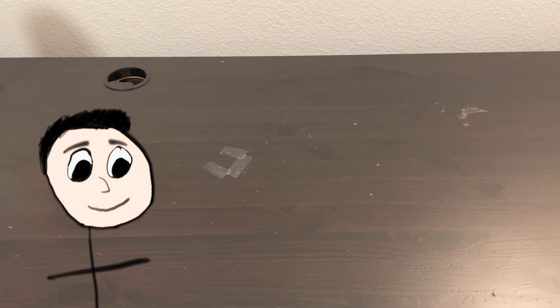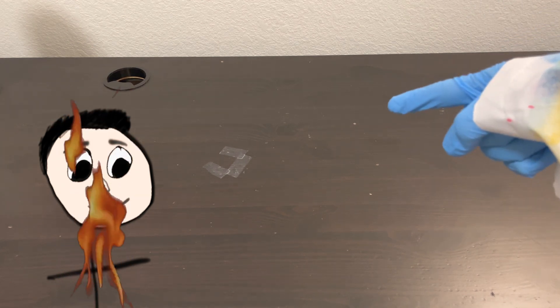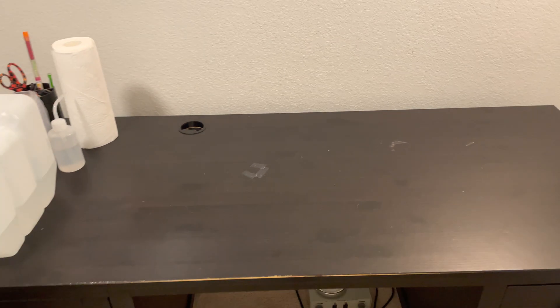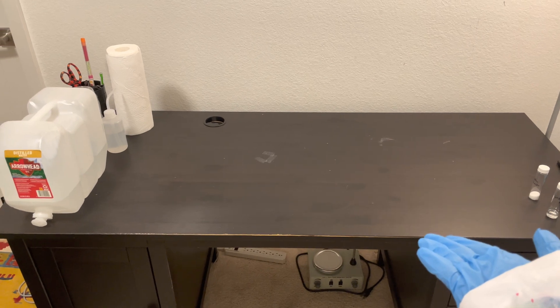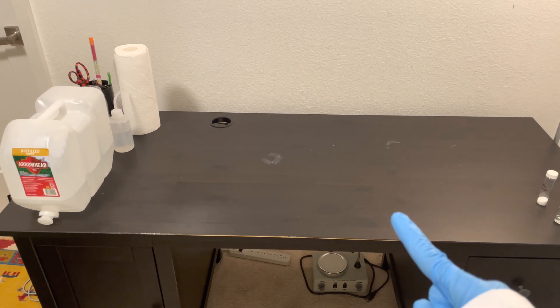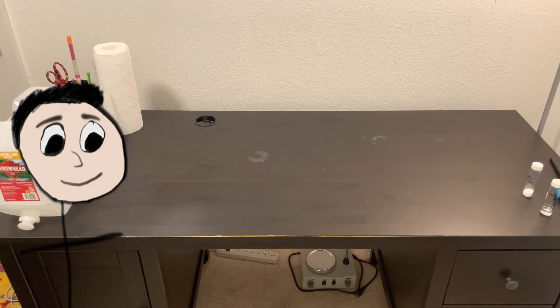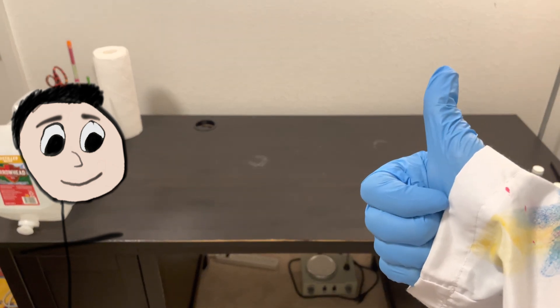Obviously I knew that I was going to be working with fire on my lab table — my lab table, which is a wooden desk. Starting a chemical fire on a wooden desk is a pretty foolish idea. So that's exactly what I decided to do.